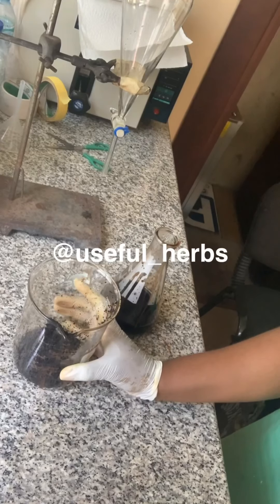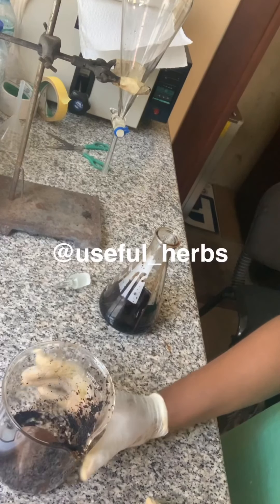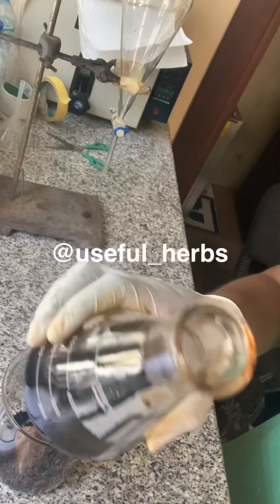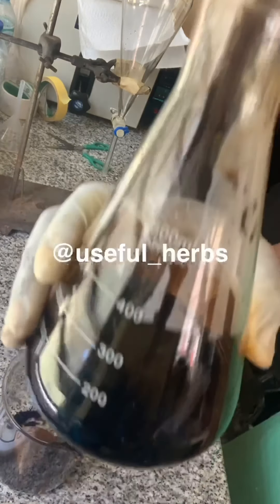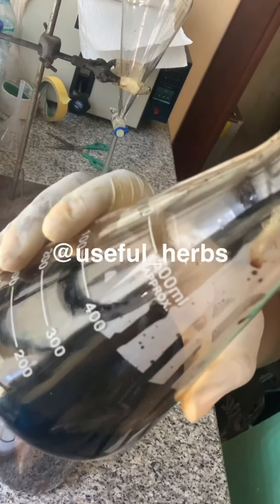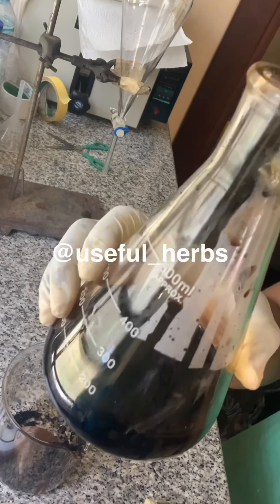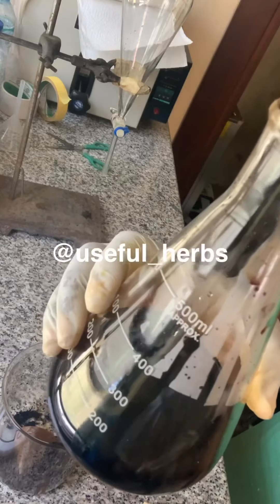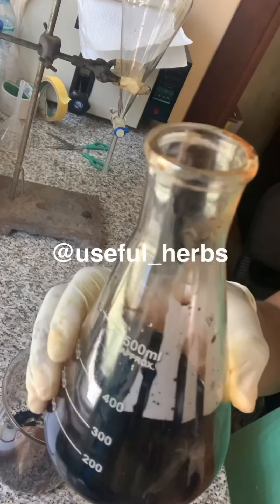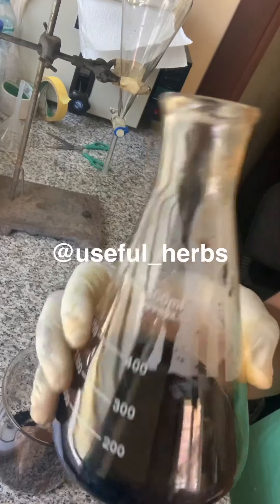Okay, so let us make some definitions. This is what we call filtrate. Okay, because I want us to use scientific terms and to help people to understand the scientific terms.